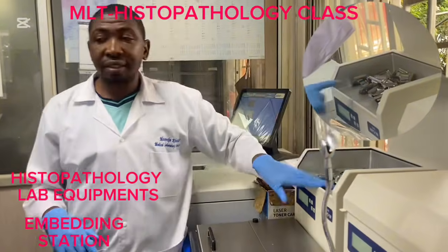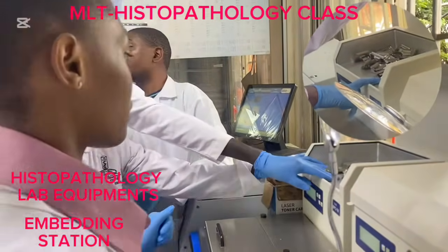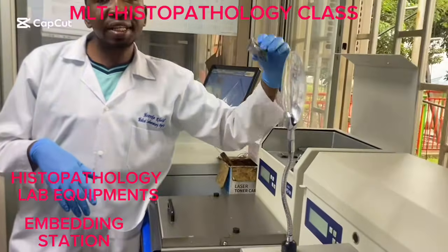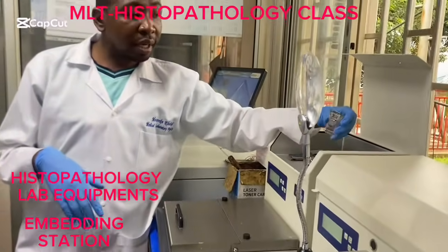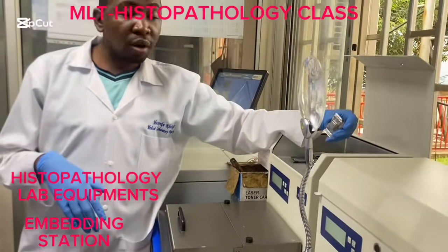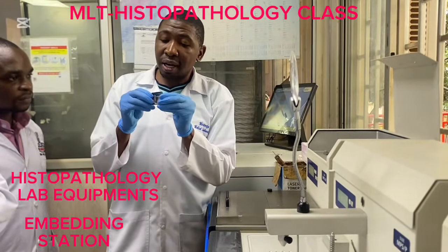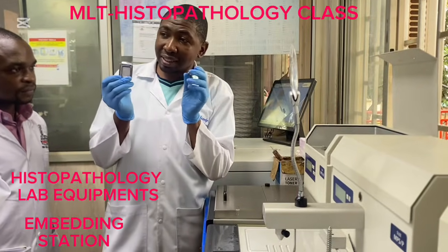Let's touch there, the surface. Okay, these are metallic embedding molds. So this compartment is kept warm, okay? Why? We want free flowing of wax and prevent formation of air bubbles when we are putting in wax in the embedding mold. Okay, so this is our metallic embedding mold of different sizes.